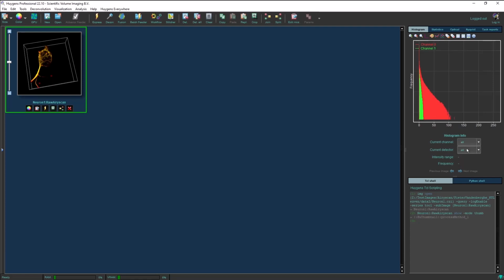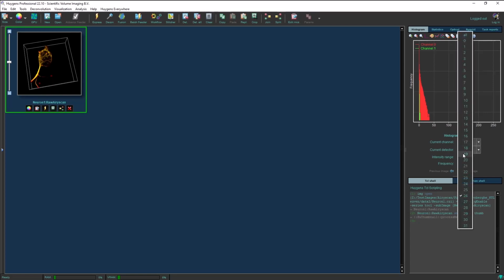However, with an array detector image, you have also got the option to view only the intensities of the central detector, detector 0, or maybe one of the outer detectors, like detector 26. And this can give you insight into the alignment of your microscope, and especially if the alignment is proper. You can check this by seeing if there are significant amounts of intensity collected by all the detectors. And you can do this by cycling through the histogram in the main window.